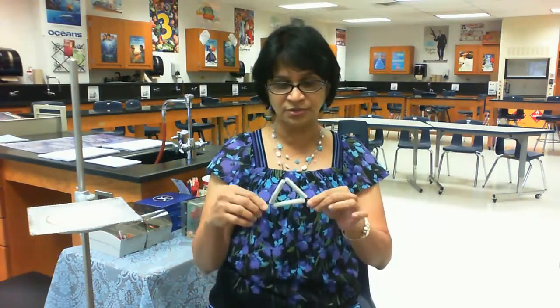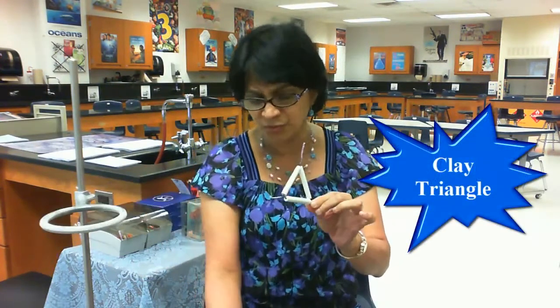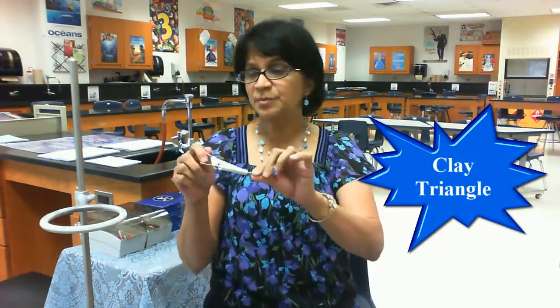The only other thing which I had to show you is this clay triangle, and there are times when we have to heat some stuff pretty strongly. We can use the clay triangle as support. So both the clay triangle and the ring stand give some support to the equipment which we are going to heat. So I guess we covered the basics of the equipment and how they are used.